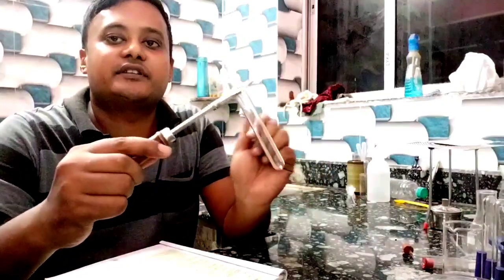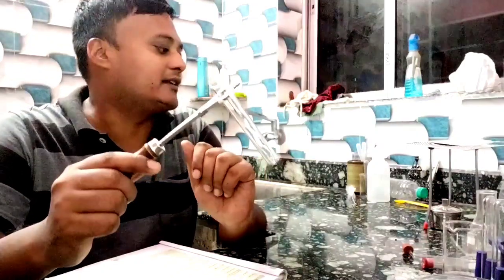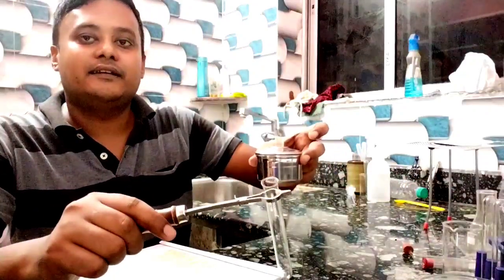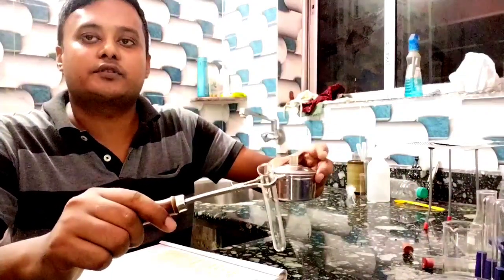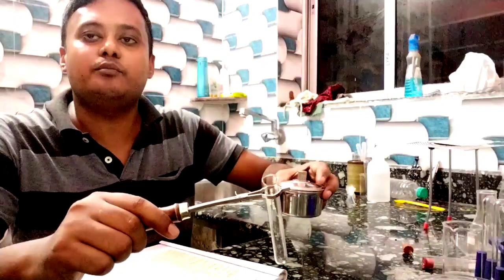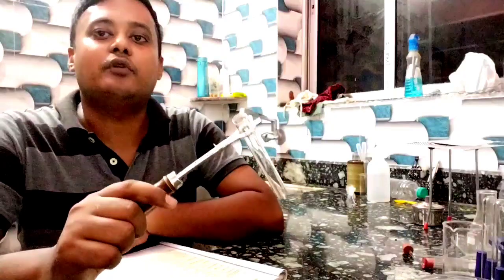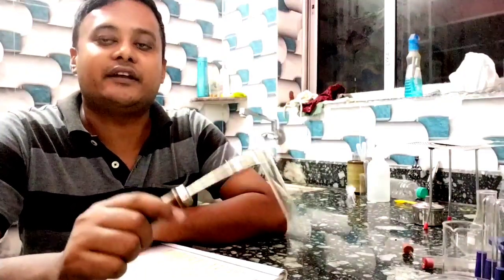During heating, we hold the test tube in this way. For heating purposes I will show you the spirit lamp — for small-scale heating we can use the spirit lamp instead of a Bunsen burner. That is the test tube holder, used to hold any test tube during heating and during handling of harmful chemicals.